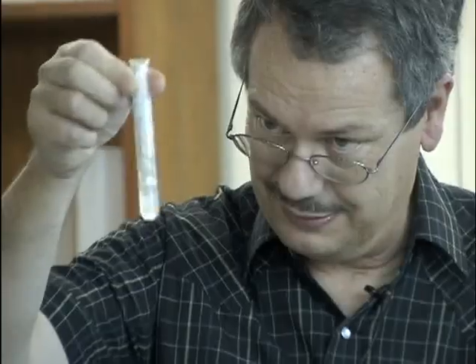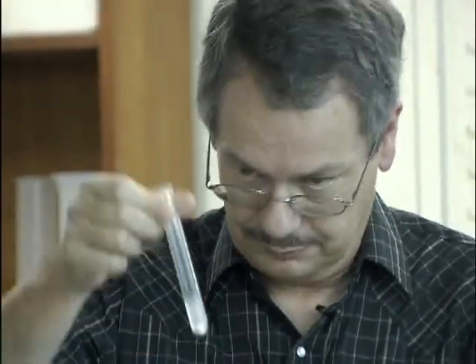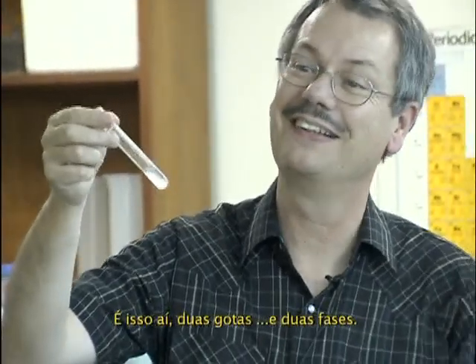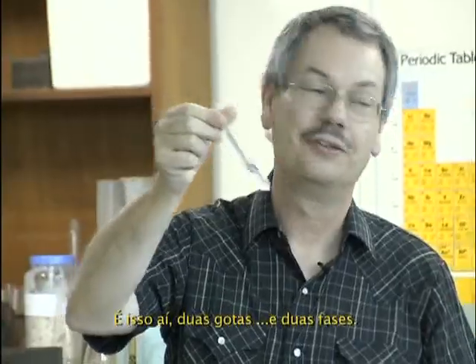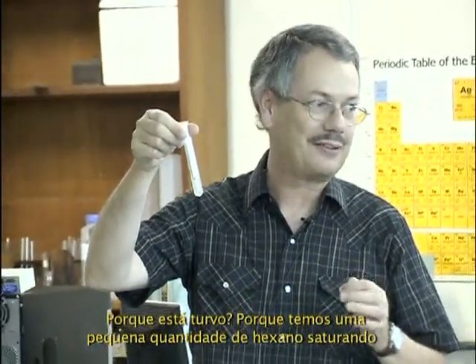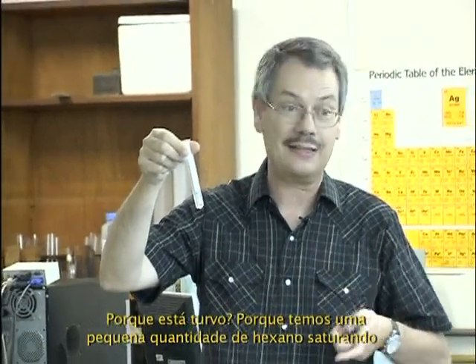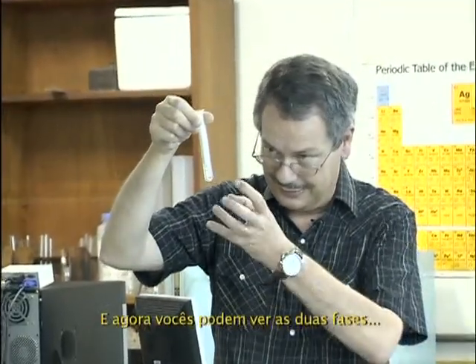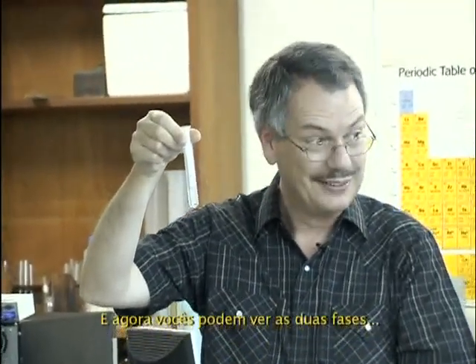I think that's it. Two drops, I get two phases. So why is it cloudy? Because there is a very small amount of hexane that saturates itself in, and now you can see the two layers.